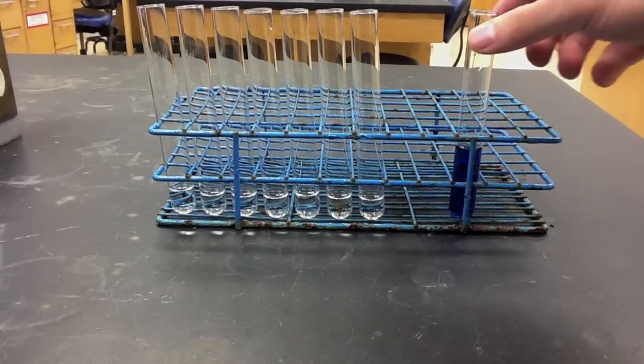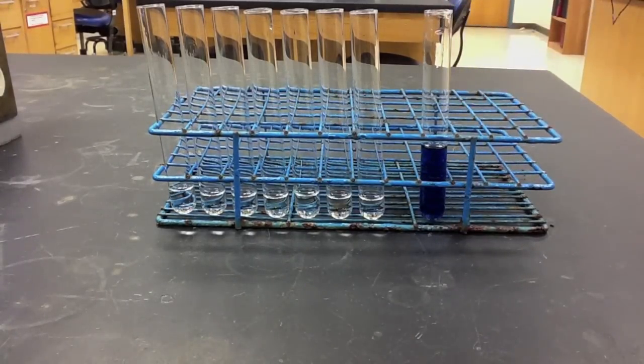Please note that currently with the unknown sample, even though I get the color change, I cannot determine the pH as I don't have a colorimetric scale to compare that to.